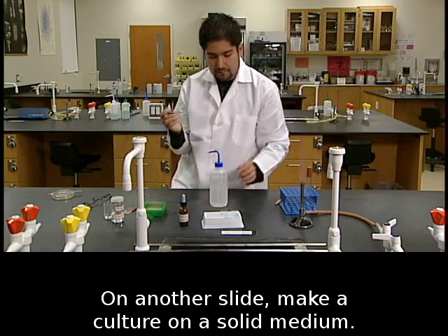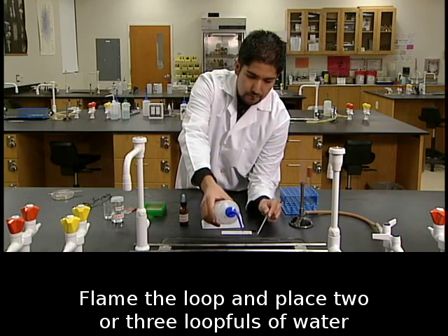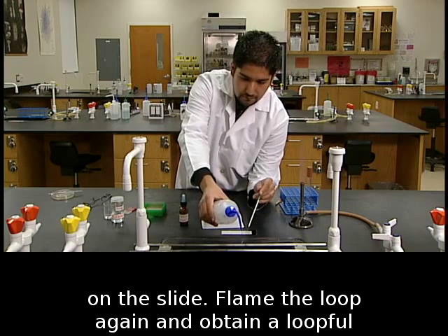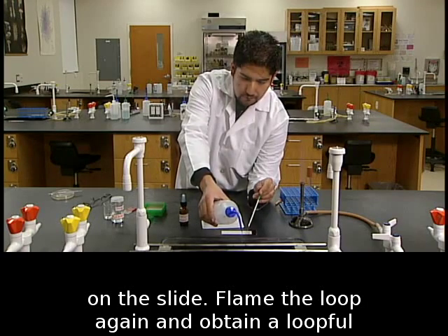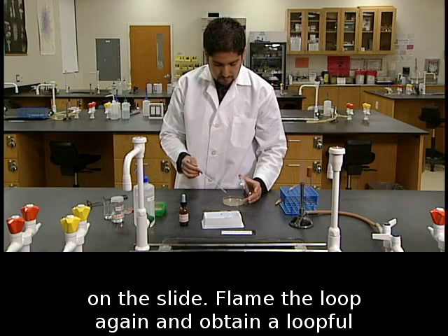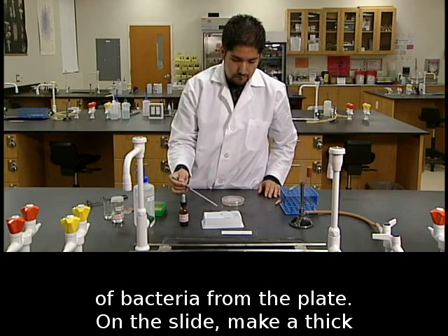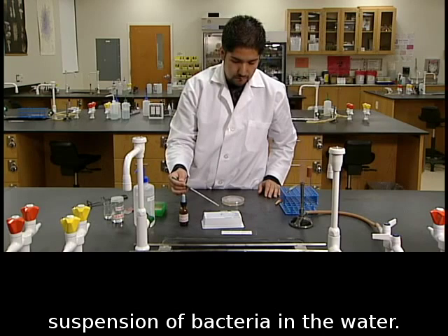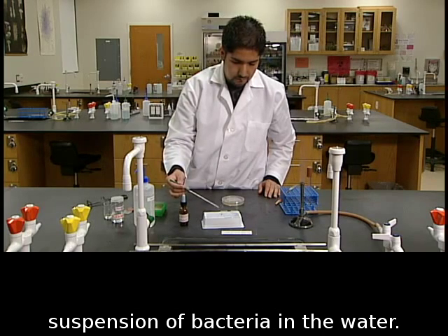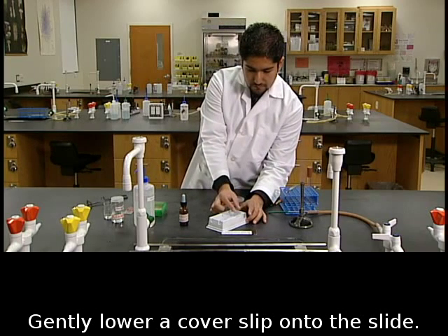On another slide, make a culture on a solid medium. Flame the loop and place two or three loopfuls of water on the slide. Flame the loop again and obtain a loopful of bacteria from the plate. On the slide, make a thick suspension of bacteria in the water. Gently lower a cover slip onto the slide.